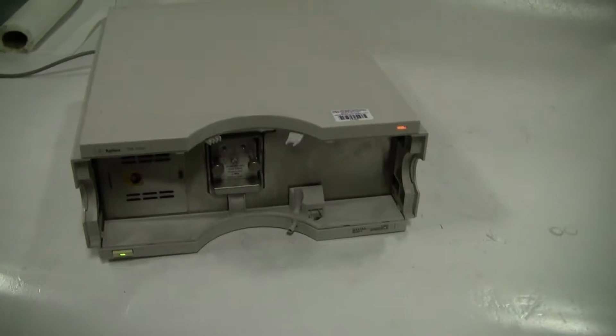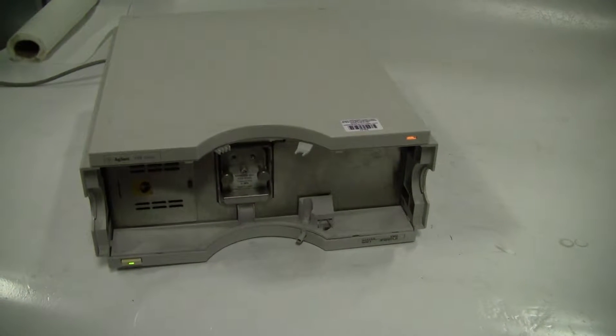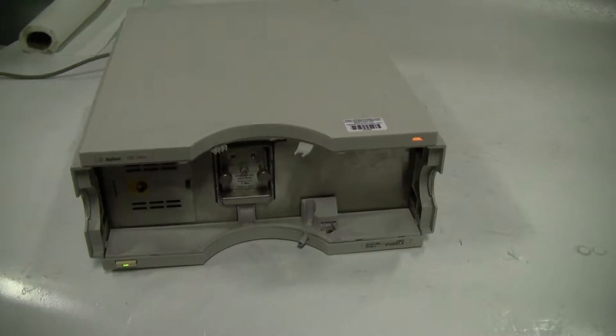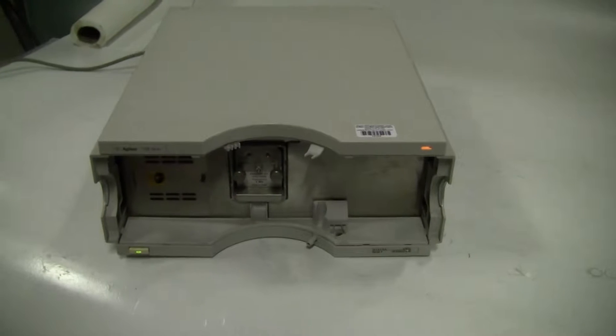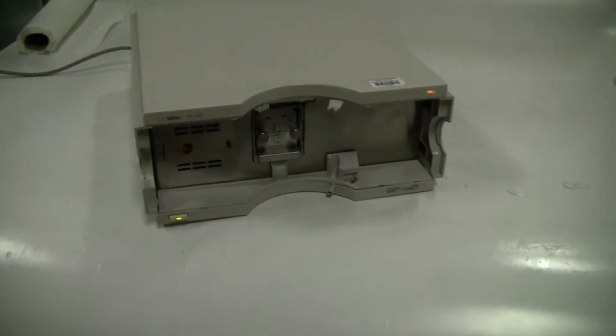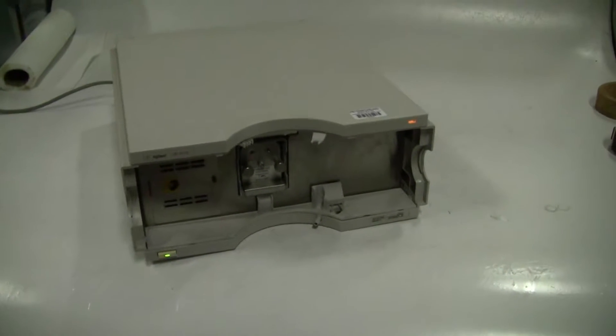Here power up. Now without being hooked up to the full chromatography system, we're not going to get too much data out.